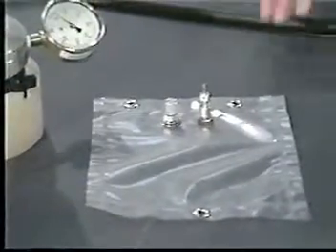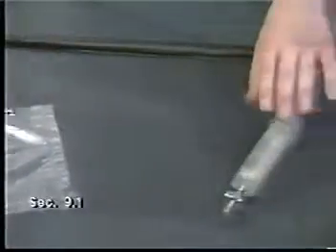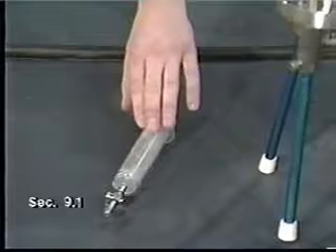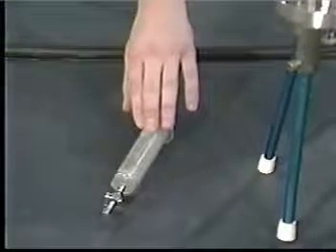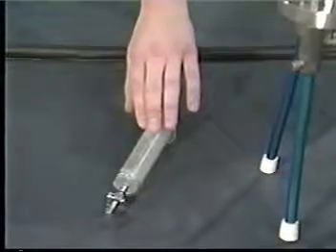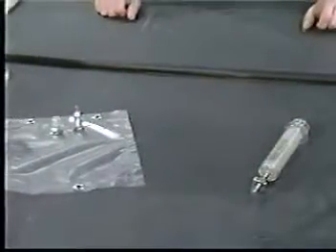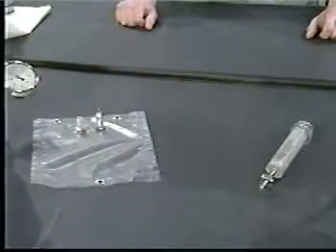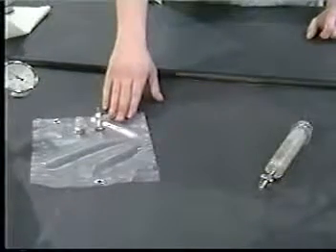Before starting the procedure, determine what type of container will be used to collect the liquid filtrates. The two acceptable types are the Tedlar bag, which is often preferable because of its large capacity, and the gas-tight syringe. The syringe has the advantage of being reusable, but does not have sufficient volume to accommodate every type of waste. The method allows either the glass syringe or the Tedlar bag to be used, but not both, unless the initial liquid phase and the aqueous extract are to be physically combined. If they are to be combined, only the Tedlar bag may be used.